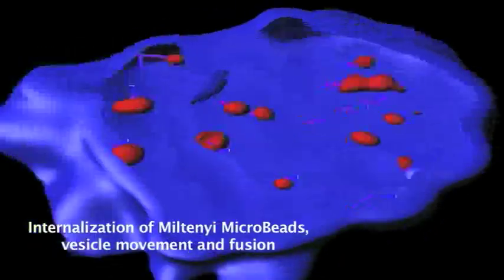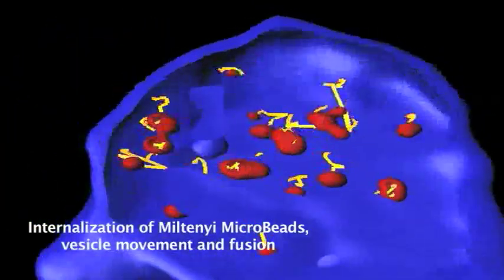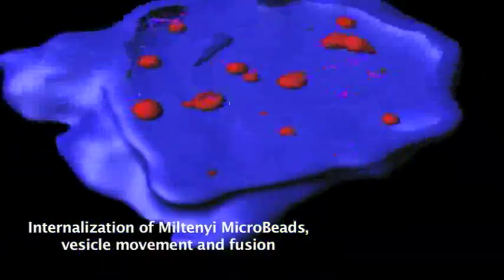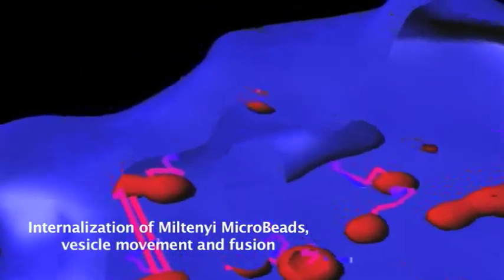Now we will zoom in on a cell to see the beads being internalized and vesicle movements. Here is a closer zoom that shows internalization of the Miltenyi microbeads along with vesicle movement and fusion.